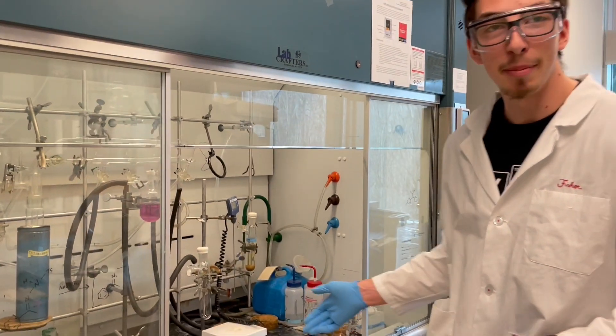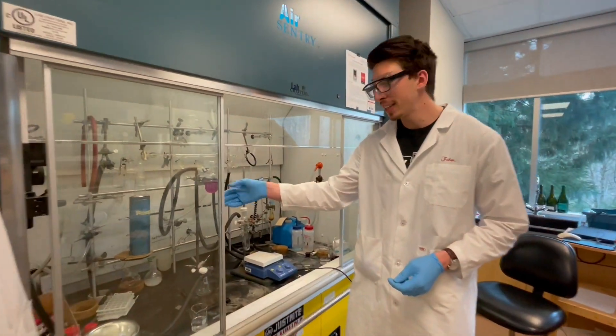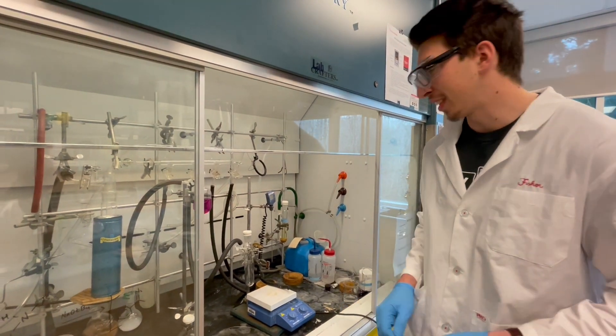As you can see, I have our setup here. We have our transfer flask and our receiving flask. They've already been cycled on to the Schlenk line.